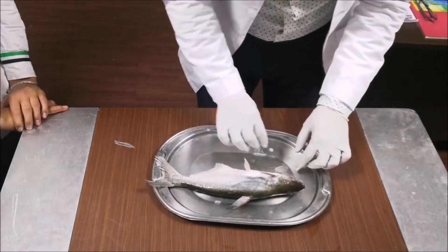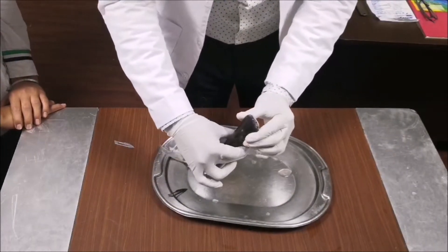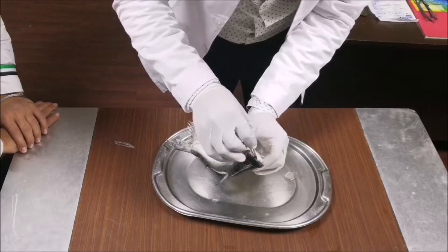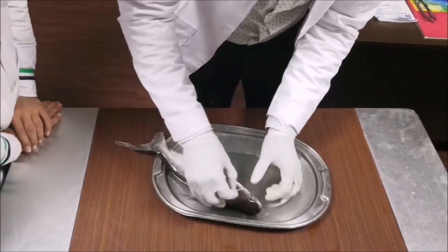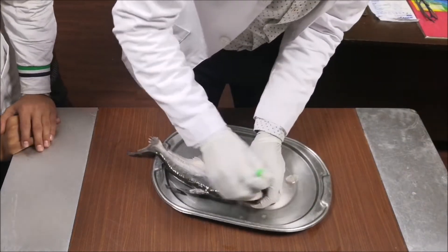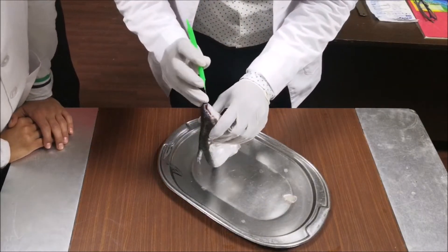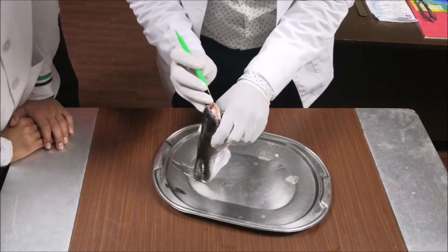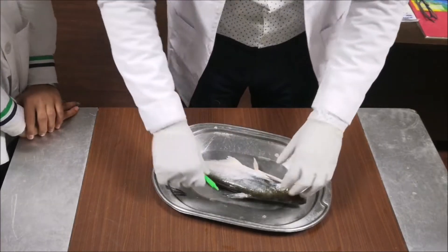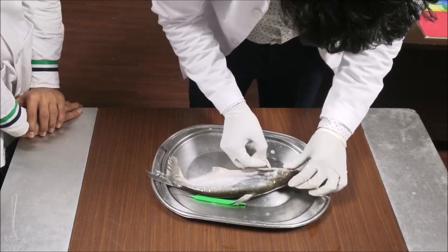Now for respiration and other things, what they do is they try to open the mouth and create a pressure difference inside the mouth and outside. They take oxygen which is mixed in water, and then later on they exchange gases in the gills.